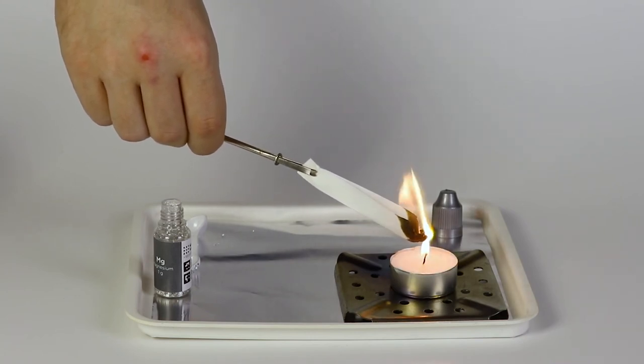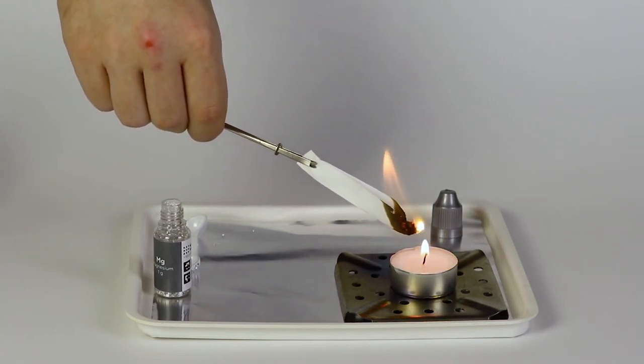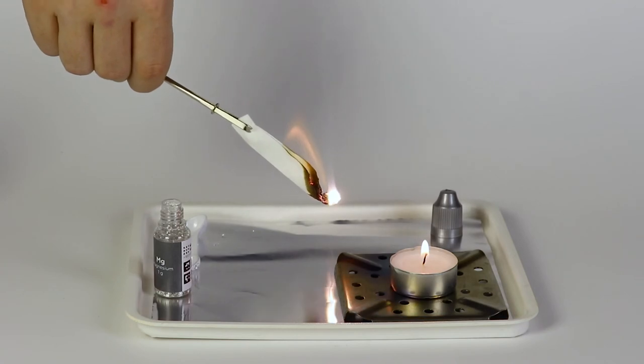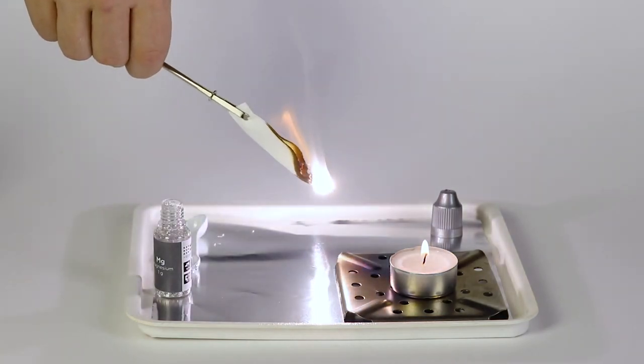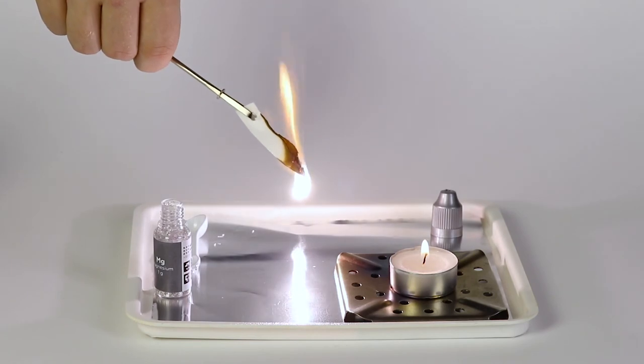The burning of magnesium is its reaction with the oxygen in the air. This reaction proceeds vigorously and results in the formation of a great amount of light and heat.